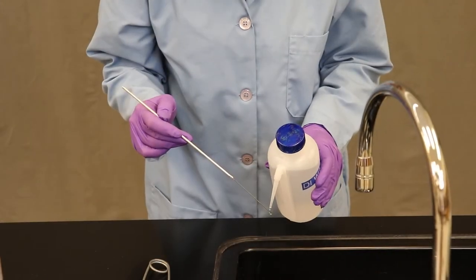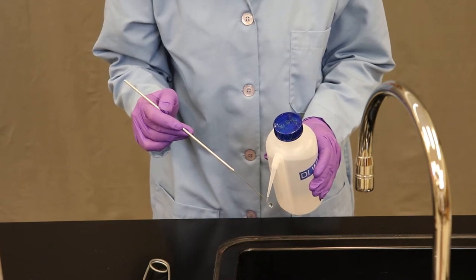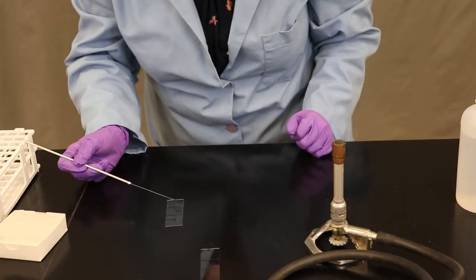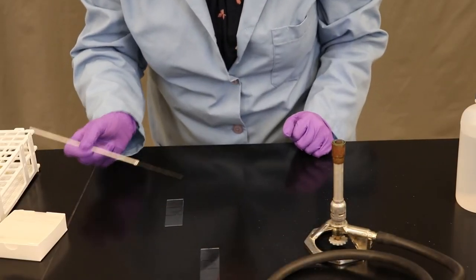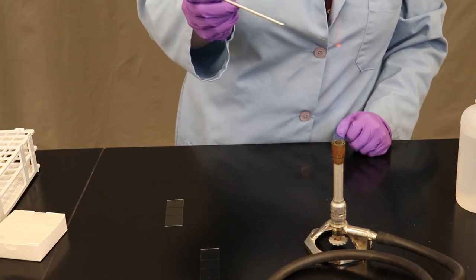For the solid culture, we're going to add a few drops of DI water. Alternatively, you could use tap water if you wish. And we're going to place a droplet down onto the glass slide first. Be sure to sterilize your loop before picking up your E. coli culture.